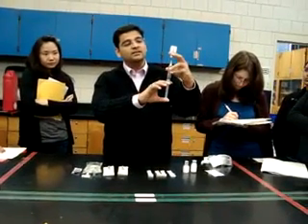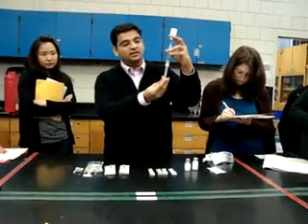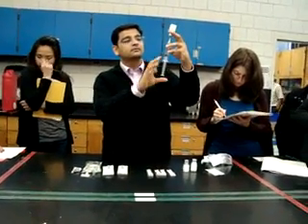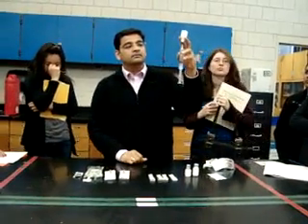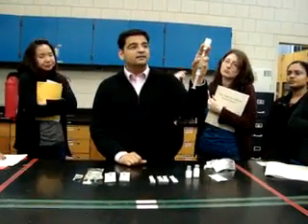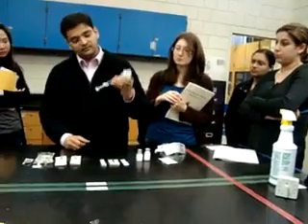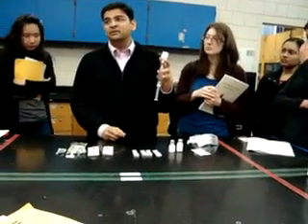So I am going to push this back a little — my bubble is gone. I am still not touching the plunger with the other hand. With the other hand I take the required volume of the diluent. See, there are no air bubbles now — there is a teeny tiny one here, but don't care about it.